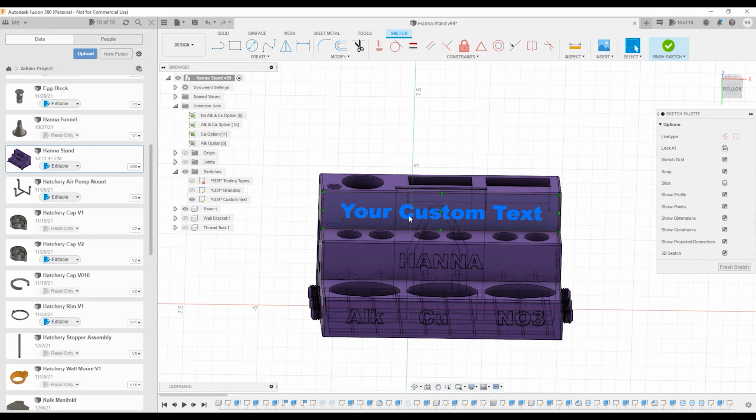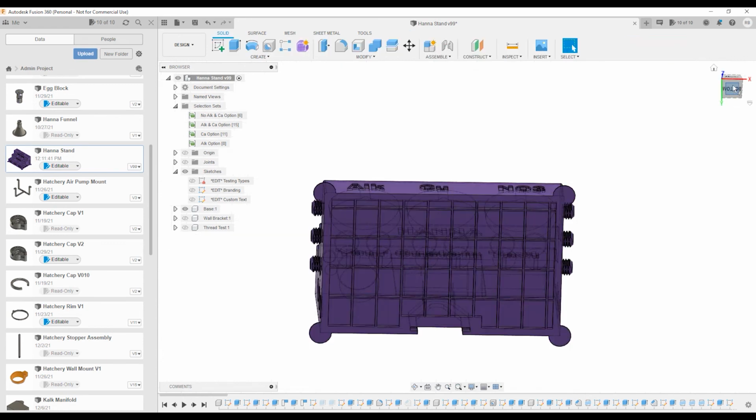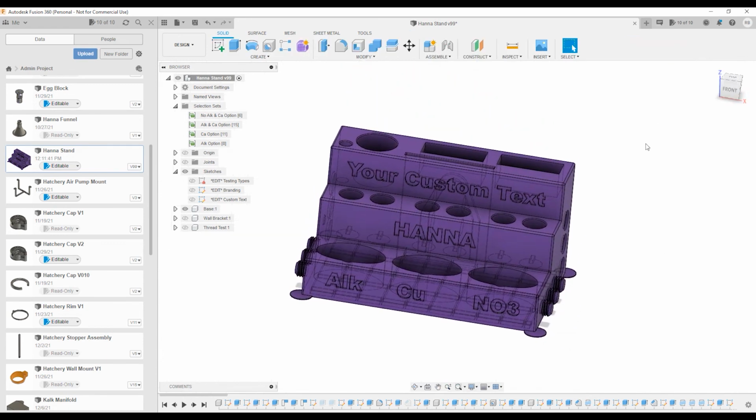Now, if you cram too much text in here, you can certainly reduce the font size and fit a little bit more in there. So we'll say OK. And then we can see that we have our custom text here. And simply put, that's all you have to do.